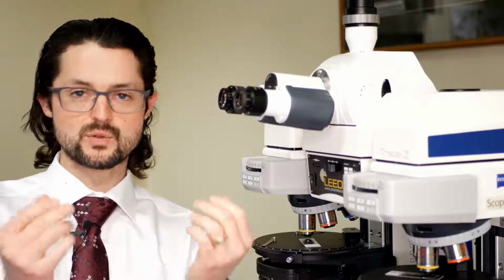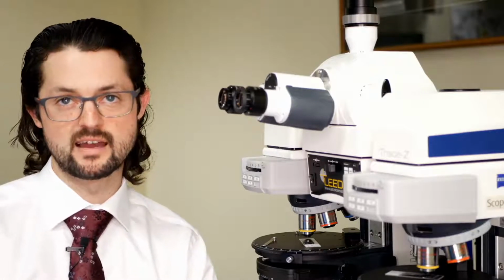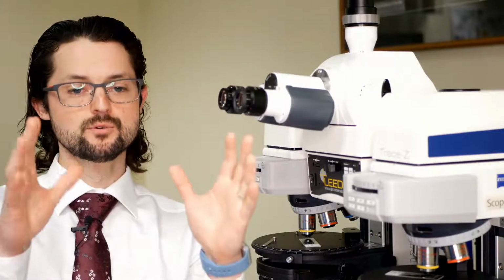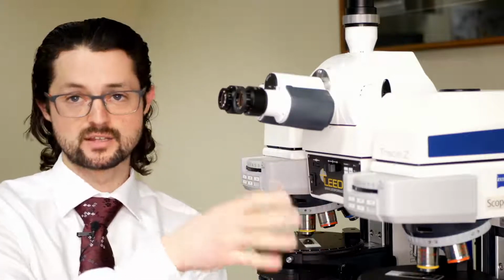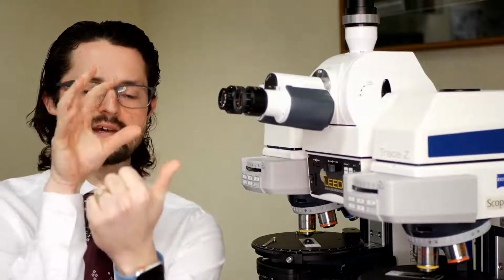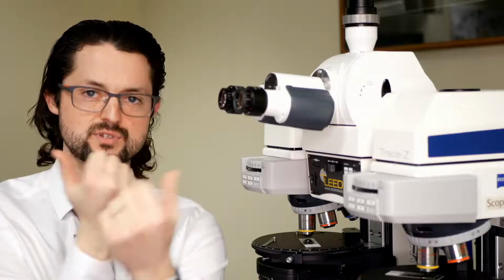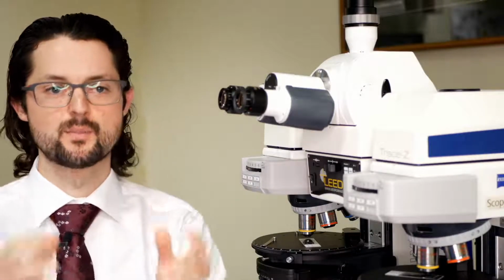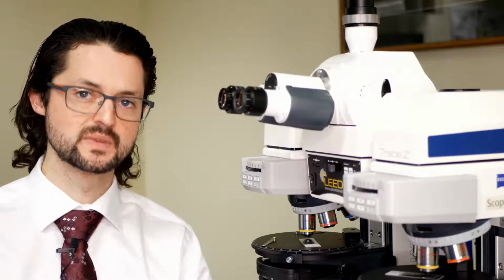And so what we had to do in the past, even as of, I would argue, maybe 5 or 6, maybe 10 years ago, is we'd sell you, on your comparison scope, a reflected light illuminator attached in kind of a Y, basically. We'd attach the mercury light source to one joint, and we'd attach your halogen light source to the other joint. You're having to buy twice as many light sources, but they're each used for reflected light in the halogen or fluorescence for the mercury.